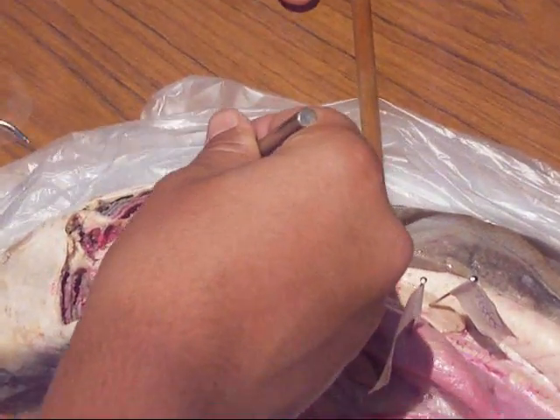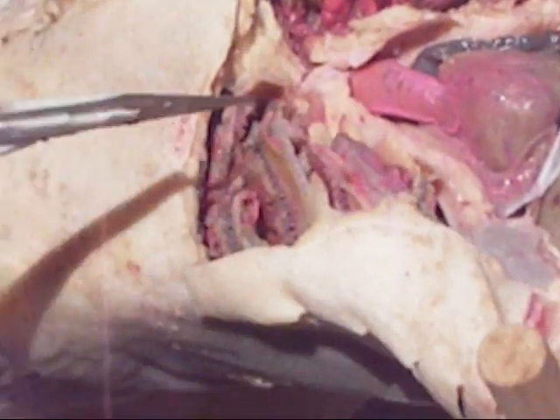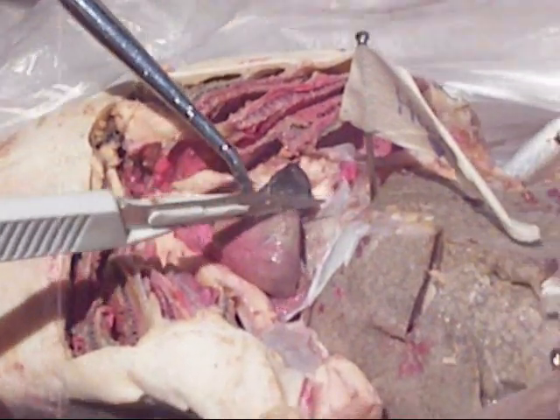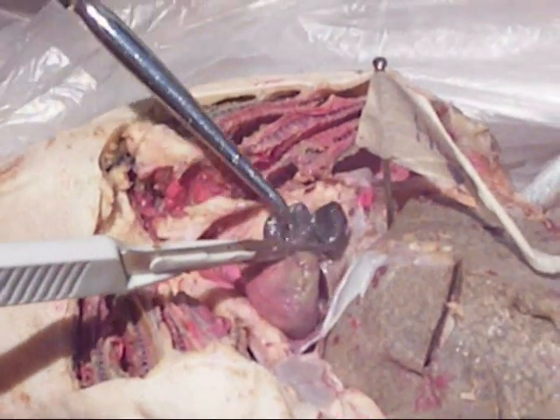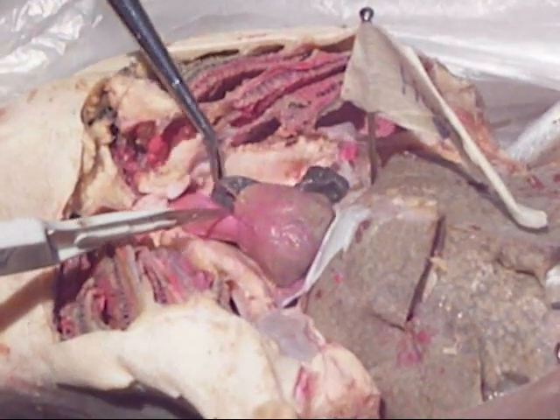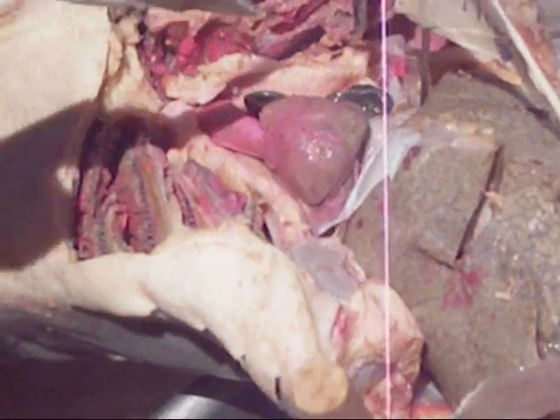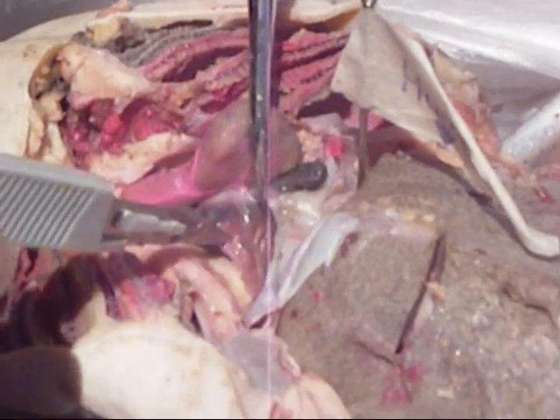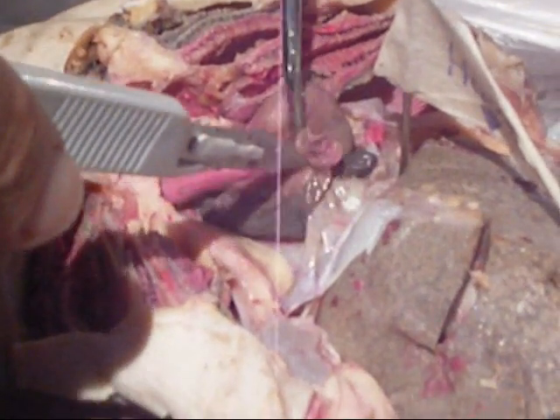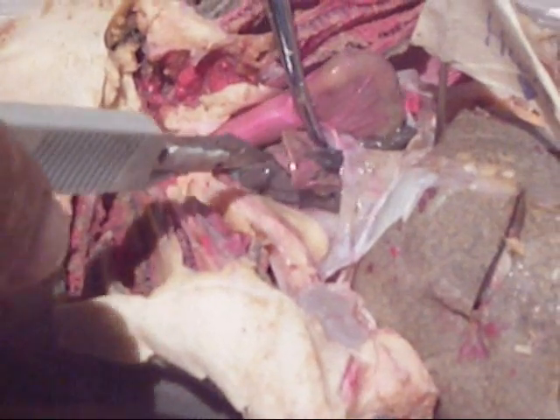And then after, what's this? Heart? No, those are gills. These are gills — these feathery things. That's the heart. With the gray things, are there too? Are those thyroids? You didn't notice this. You don't need to know it, right? They look like lungs. I think the shark has a two-chambered heart.